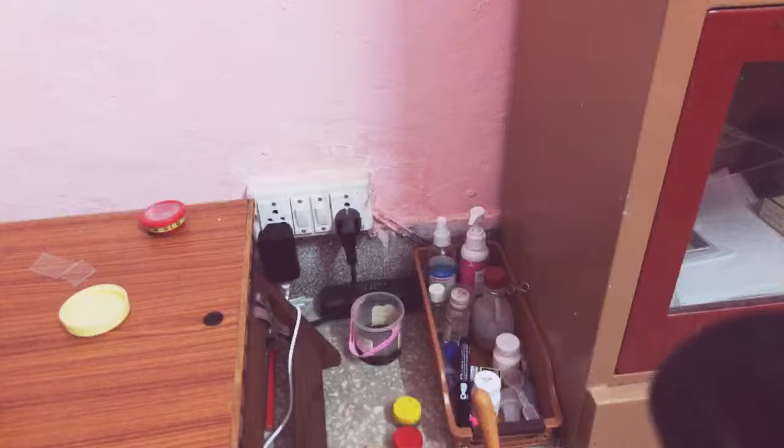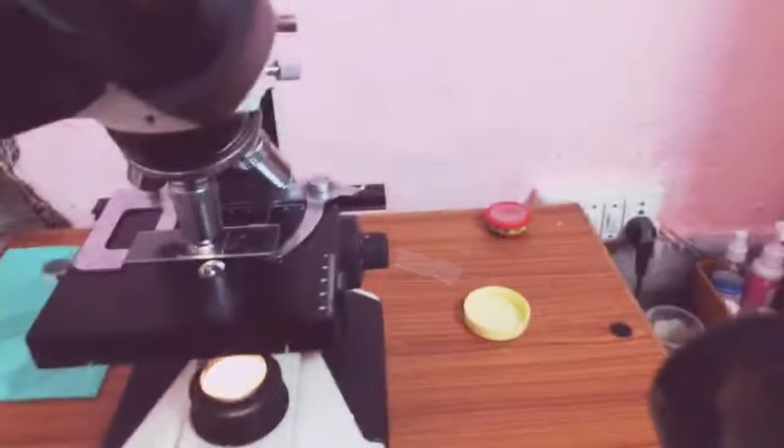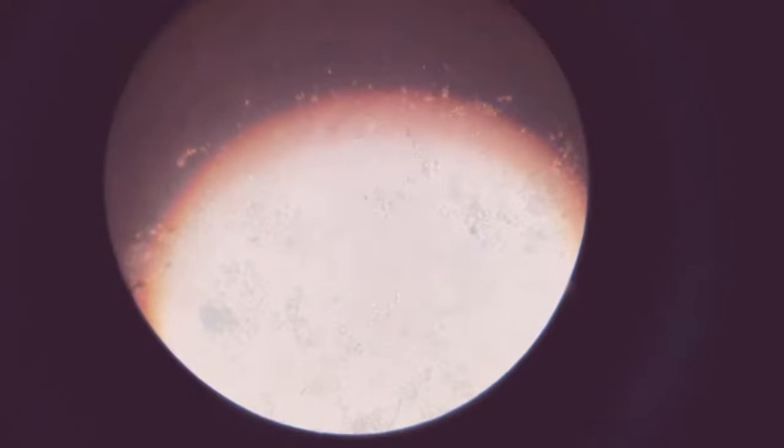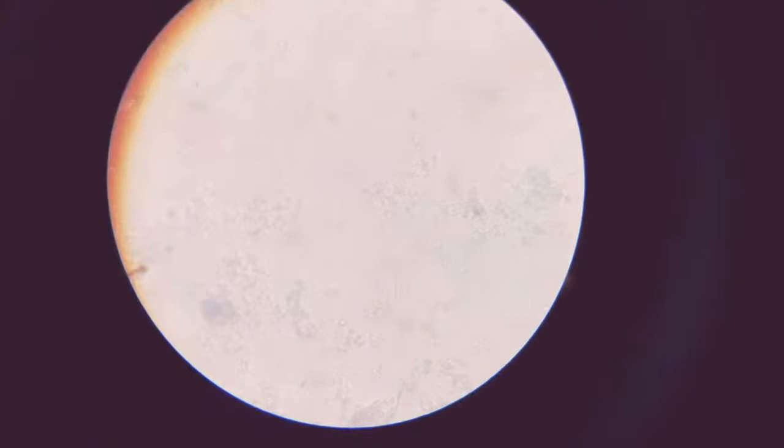Going down. Okay, so let's bring him back in the center. Just wait while I rearrange it. Here is another one. Okay, this is a bigger one. Yes, this is a bigger one. So we'll focus on this one. There's a bigger one I found. Let me bring it in focus. This is not appropriate. So need to go down. This is fine. Okay, now probably we will see this.